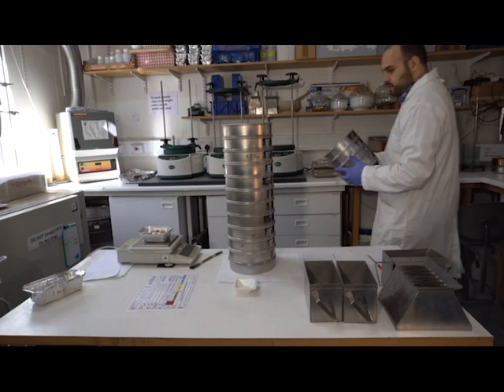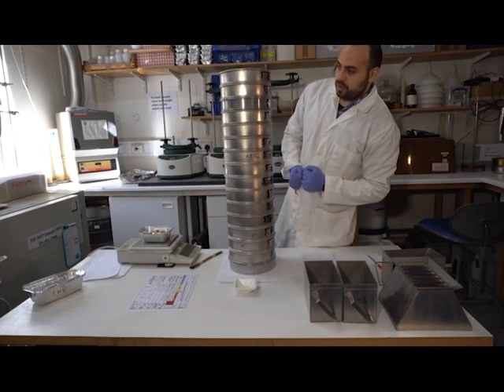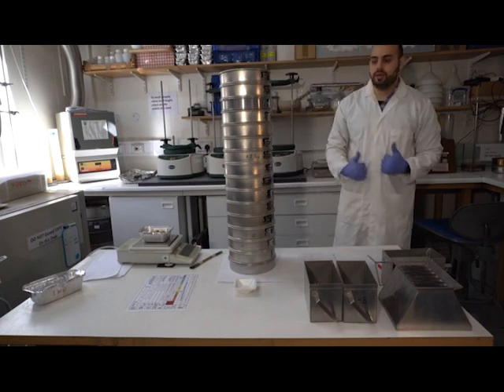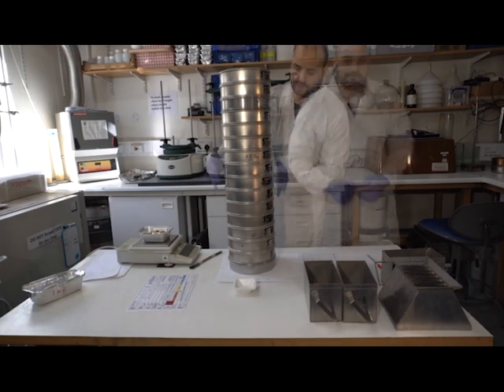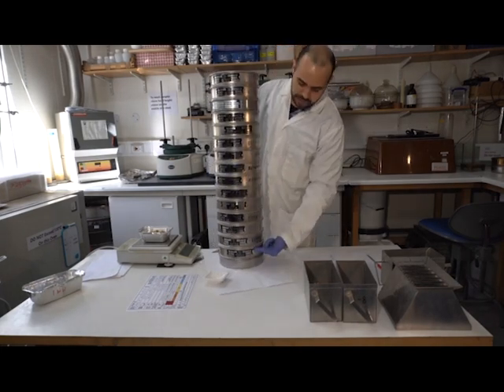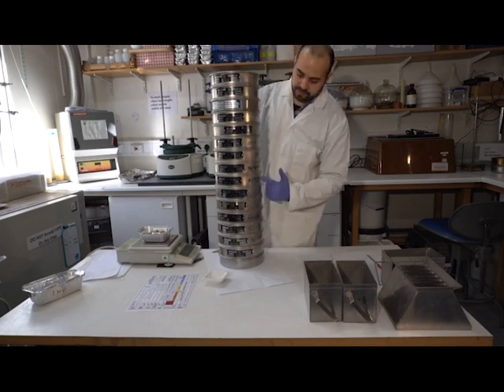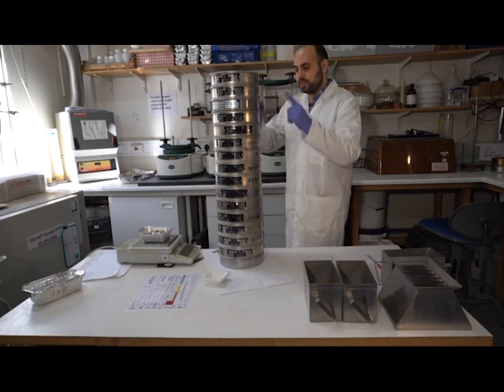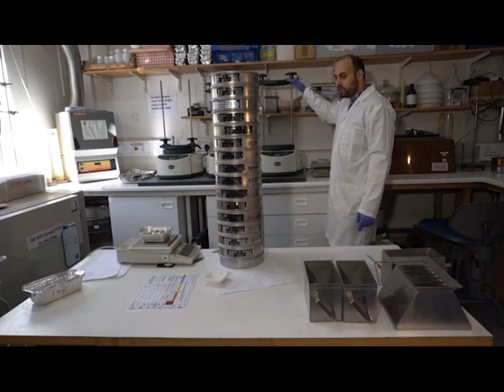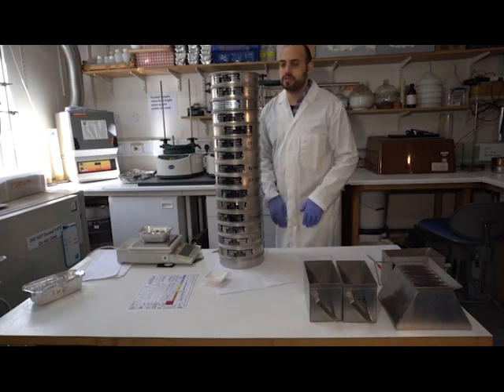Okay. So I've got my extra sieves here, 2.8, 4, 5.6 and 8, and we're ready to go. So I've got the rest of my stack here now. That goes all the way from 63 micron to 8 millimeters, jumping at half-phi scale. Now you can see that this is much taller than the height of my sieve shaker, so I'm going to have to split this in 2 goes. I'll have to do this twice.